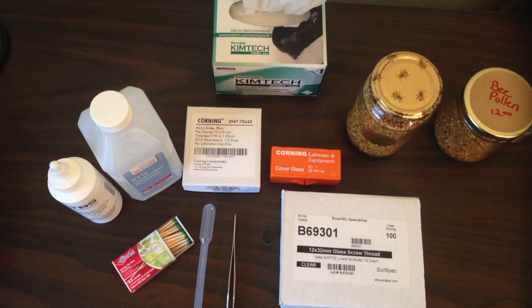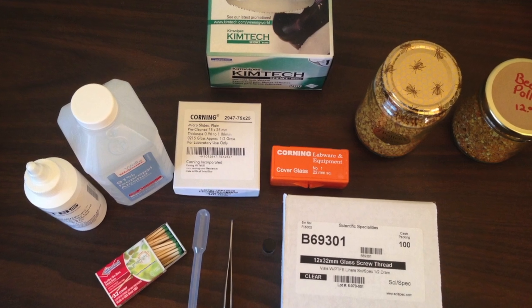We need a number of little tools to go through this process, and we'll introduce some of those tools now.